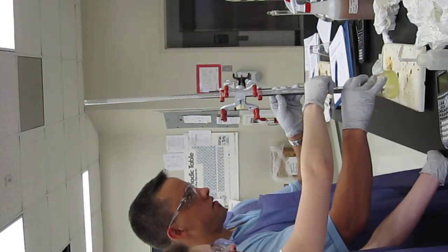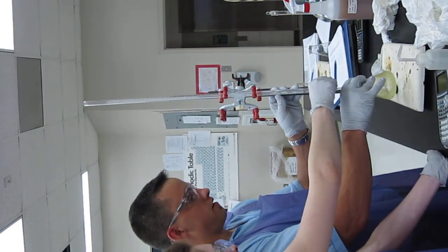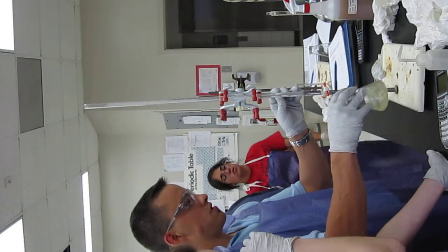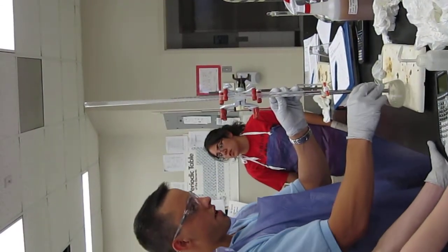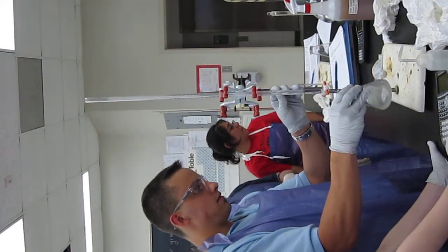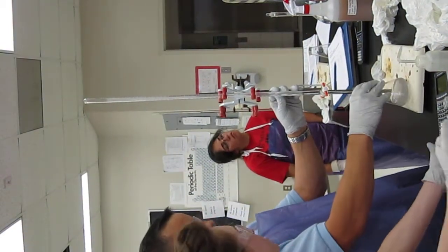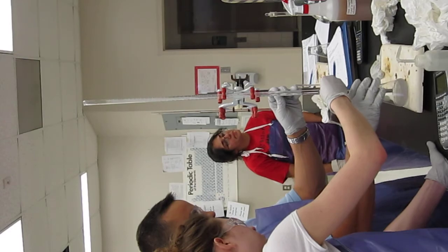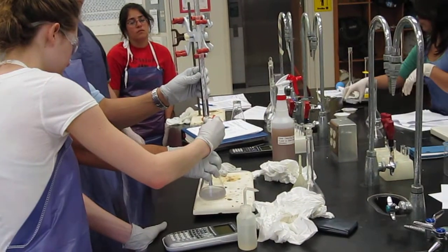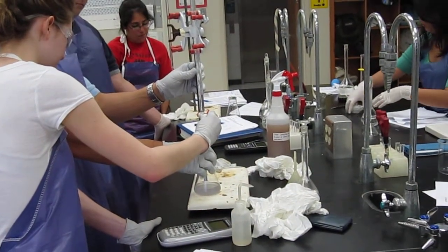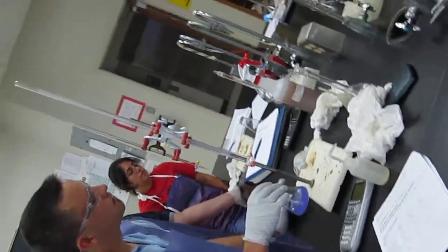You like it. Go a little more. It's good enough. Yeah. There we go. That turned dark blue. Yeah, that was cool. Alright, thank you.